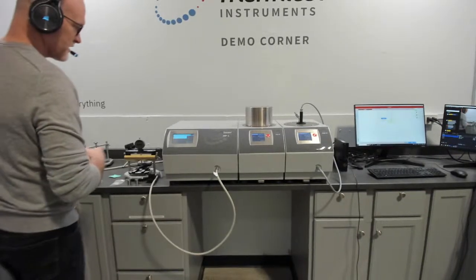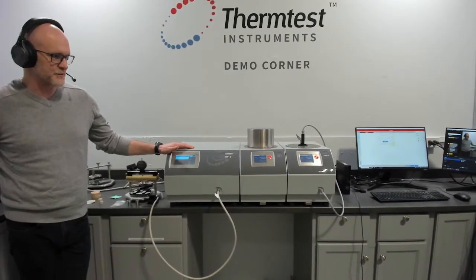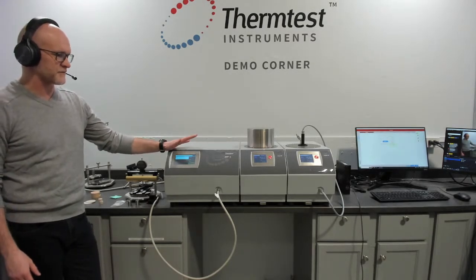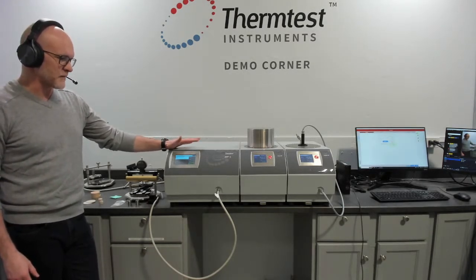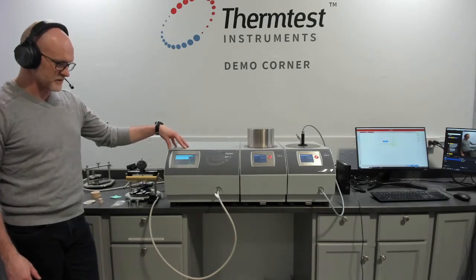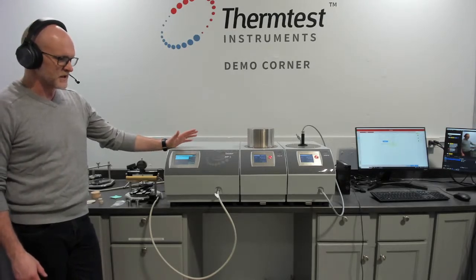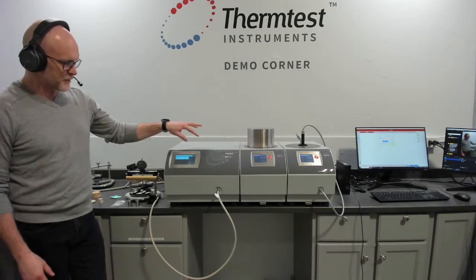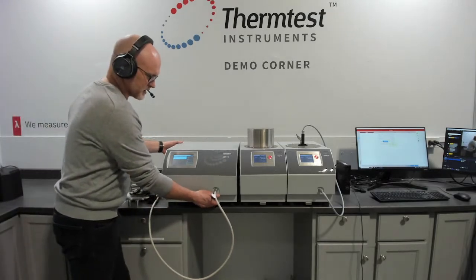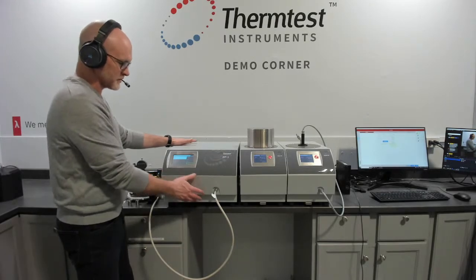So, coming back to the MP-1, if you recall the discussions around the THW and the TPS method, we brought those two together to form our marquee transient method. So this is the marquee transient instrument on the market due to several characteristics that it has. Every MP-1 can be acquired with just a controller. I separate that to show you that this is a standalone controller.